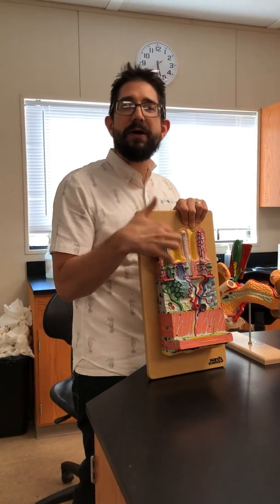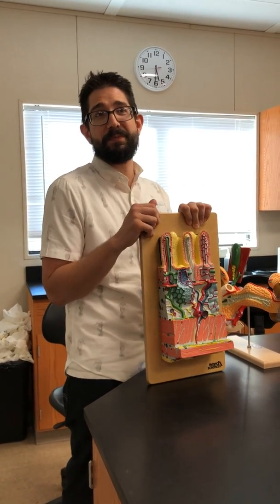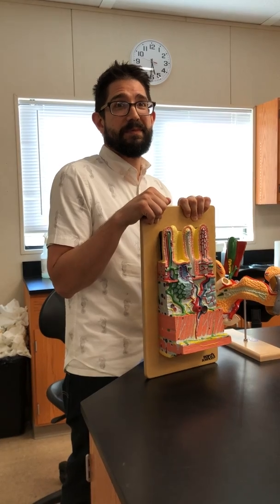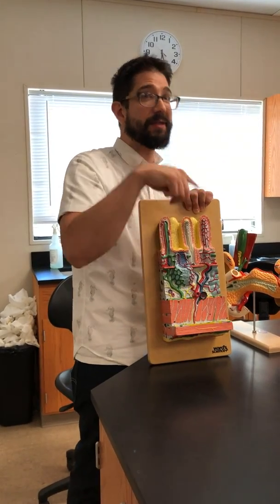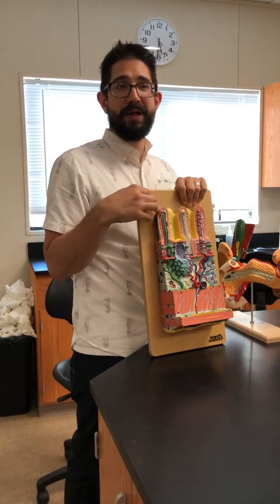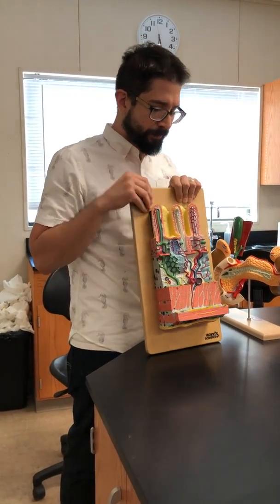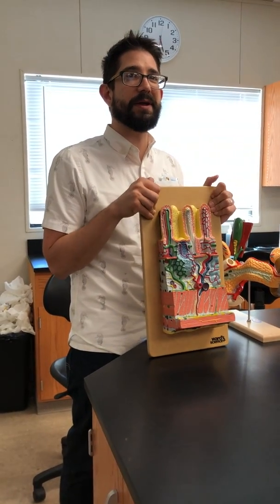You may think, maybe these are what's in the stomach? What in the stomach might look kind of like this? Rugae, yeah, because the stomach has a wrinkled lining, but these villi are tiny, tiny. They're not rugae. So how else will you know it's not the stomach?